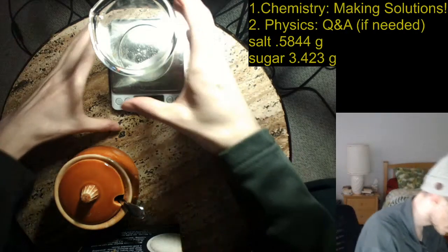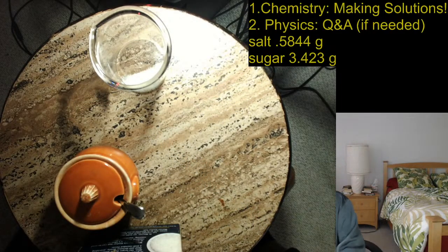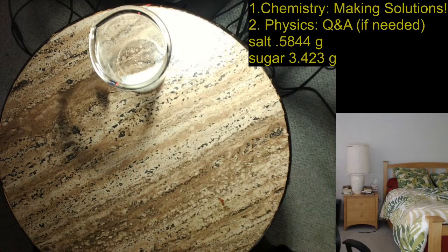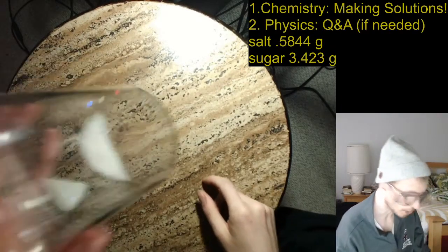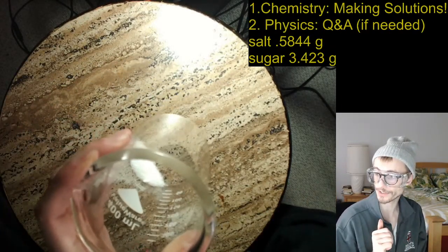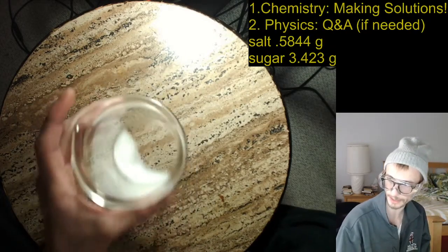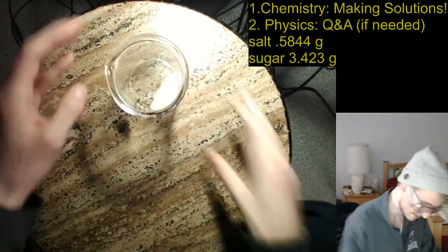Okay, so now I'm going to move my scale out of the way before I accidentally get it wet, or break it. Just threw it there. It'll be fine. And now I'm going to move my salt and sugar out of the way, and I'm going to add until I have 100 milliliters. So now right here I have 0.01 moles of sugar and 0.01 moles of salt. But in order to make a 0.1 molar solution, I still have to add the 100 milliliters of solvent. So these are both solutes, but I need solvent.